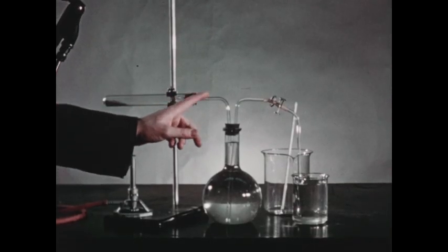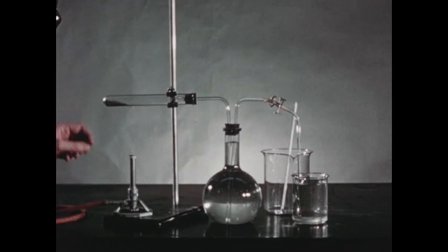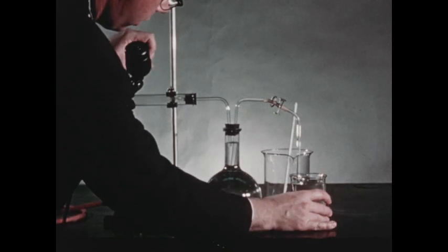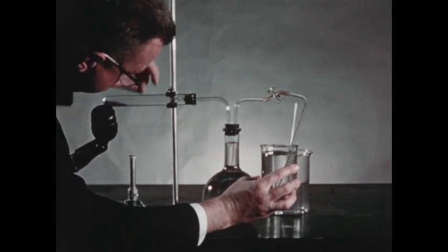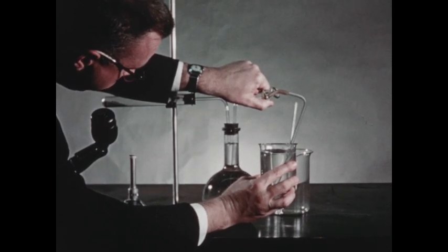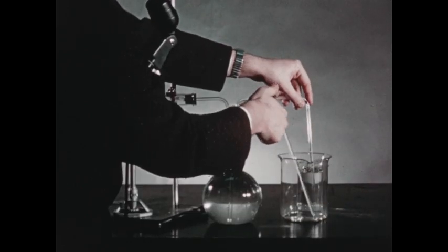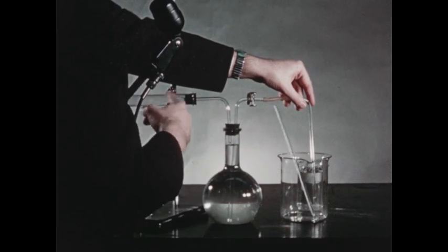I blew gently into this tube so that some water was forced out of the flask, and this tube is now completely filled with water. I attached the test tube firmly to this stopper. Our next job is to equate the pressures inside and outside the flask. We do this by raising the small beaker until the level of the water in the small beaker is the same as the level of the water in the flask. Then, opening the pinch clamp, we permit water to flow one way or the other until the pressures are equal. We then replace the pinch clamp, remove the small beaker, replace it with the large beaker, and open the pinch clamp. A few drops of water run from the tube and then stop, indicating that we have no leaks in our system.